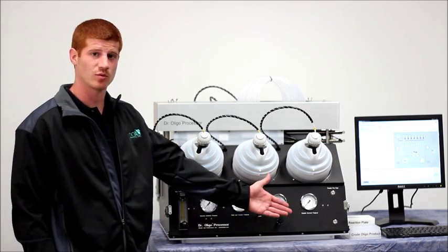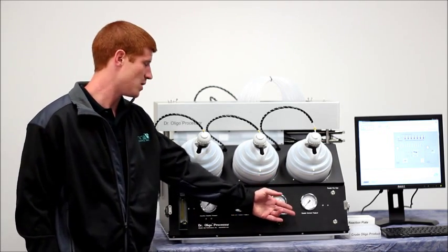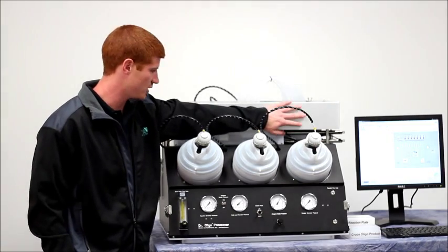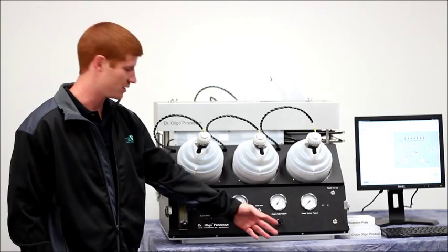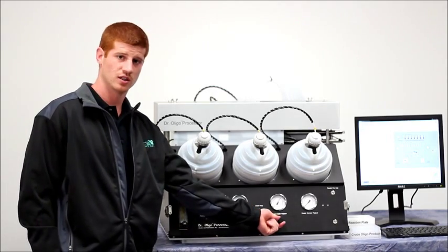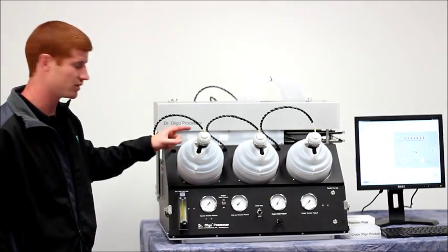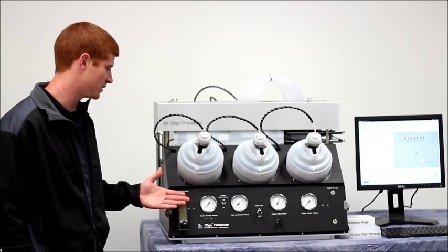The transfer chamber pressure here monitors the pressure of the transfer chamber inside here. Here we have the reagent bottle pressure gauge and regulator that's adjustable here. This monitors the pressure going into the bottles so that they deliver at different rates.